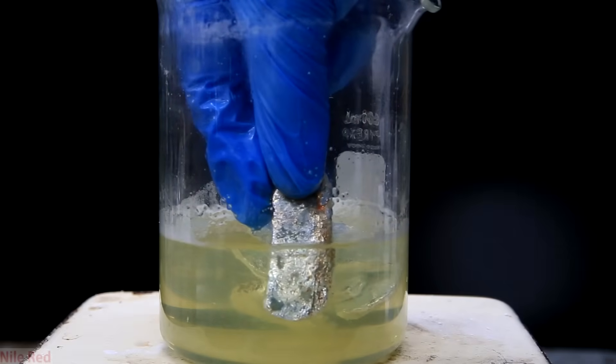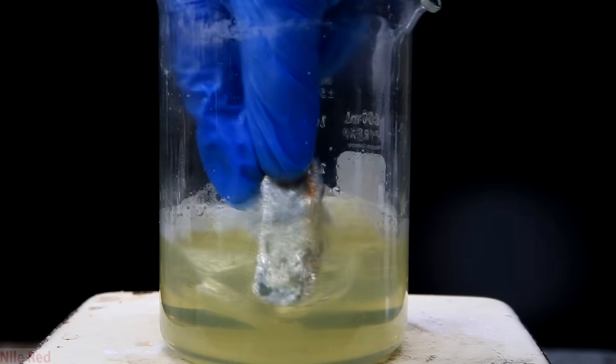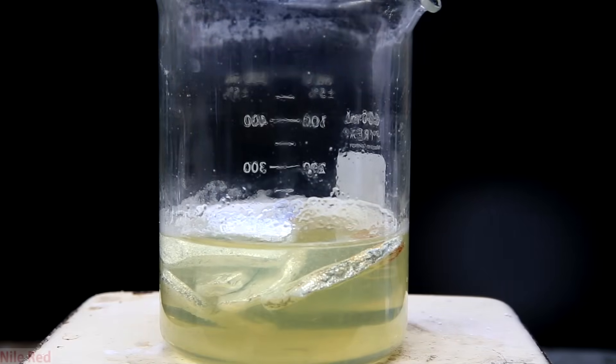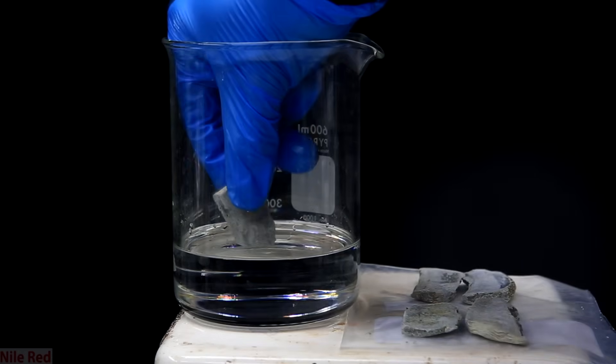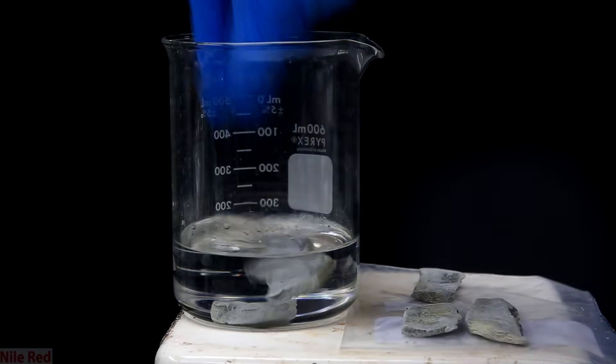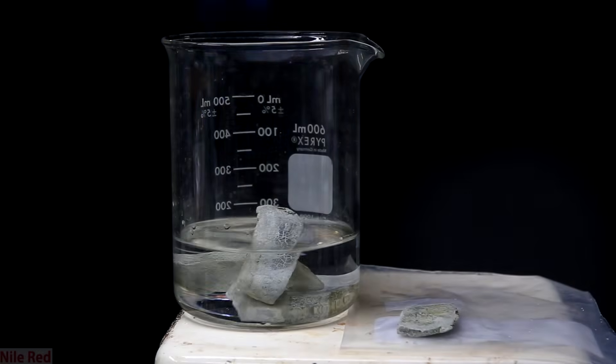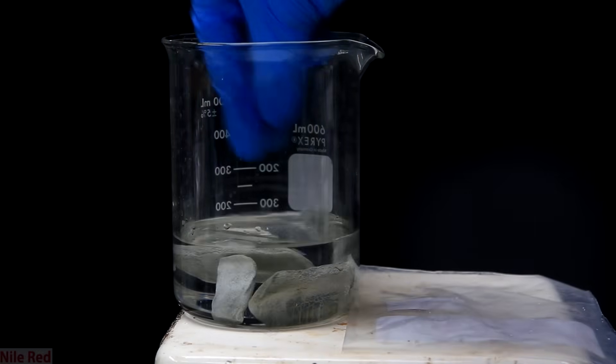Regardless of whether or not I know which oxide it is, I still have to clean it. So I'm going to do this in two steps where the first one is the neutralization of the oxides and the second one is re-melting all the potassium to one glob. I did this in two distinct steps because I thought it would be kind of crazy to get liquid potassium mixed with oxides. Now we will get started with the cleaning.